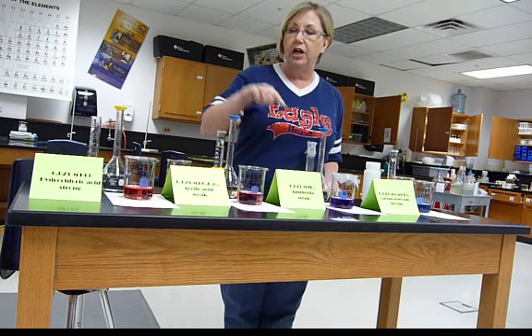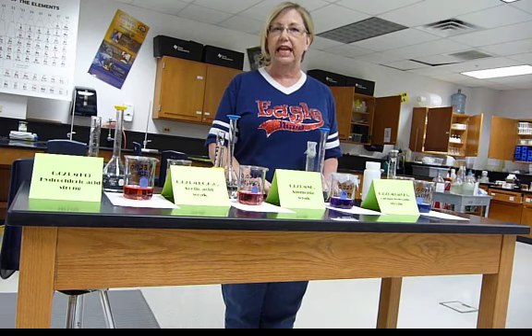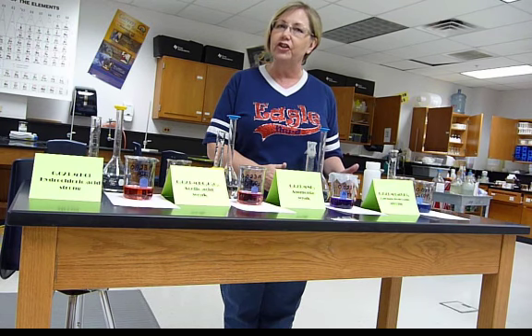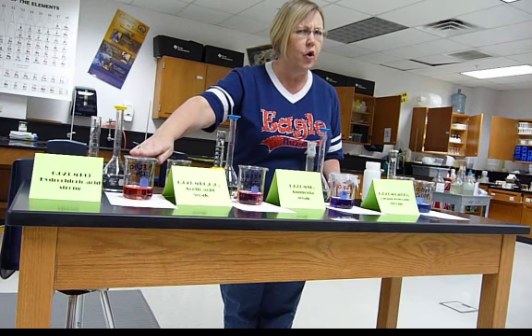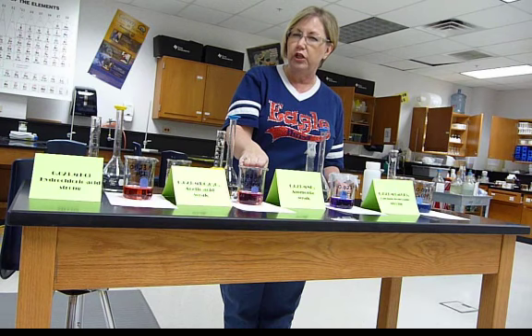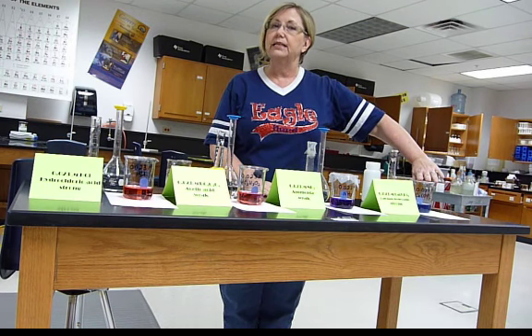Now, you notice that they're different colors. You would expect an acid to be clear and colorless. But what I've done is I've added a couple of drops of universal indicator. An indicator is a dye that changes structure with pH, and as it changes structure, it changes color. Remember, structure determines function. So over here we have our strong acid is kind of an orangey pink maybe. Acetic acid is getting more pink. I want you to write those colors down on your beakers in your notes. My ammonia is purple, and my calcium hydroxide is blue.